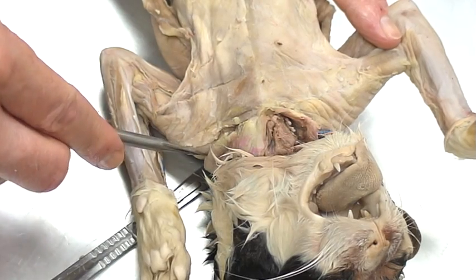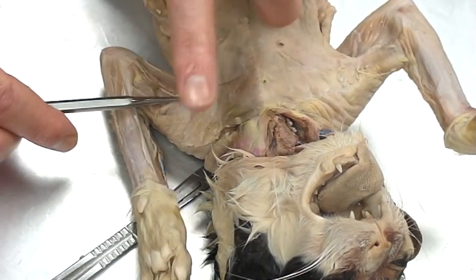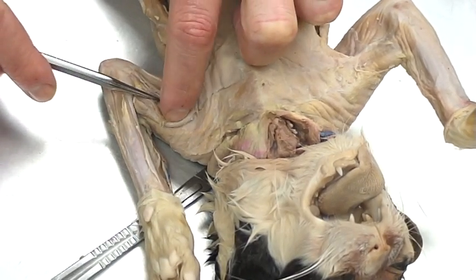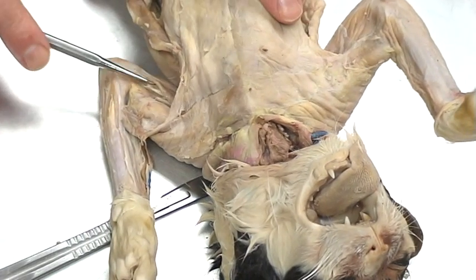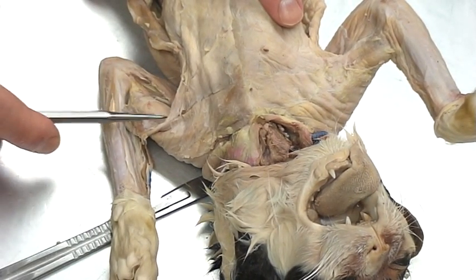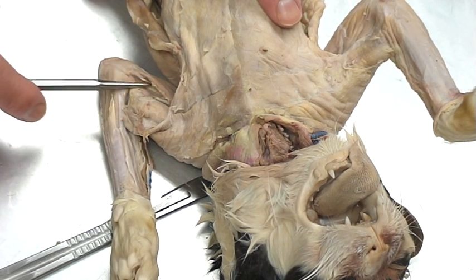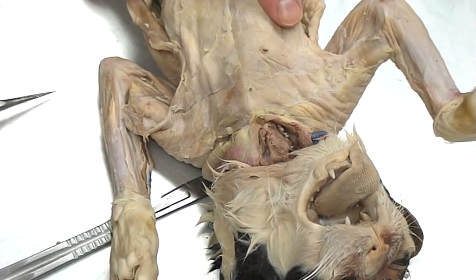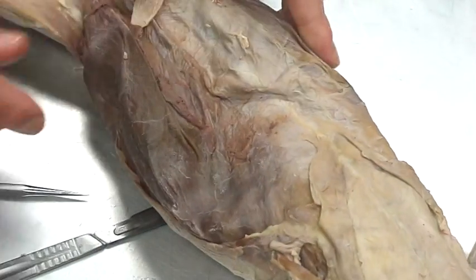On top of that we're going to find our deltoids. Now if I lift up between the pectorals and lift up here on the forearm, the medial part of the tricep — right here is going to be your biceps brachii. So I went underneath the pectoral muscles and lifted down the tricep muscle. That's the biceps brachii.